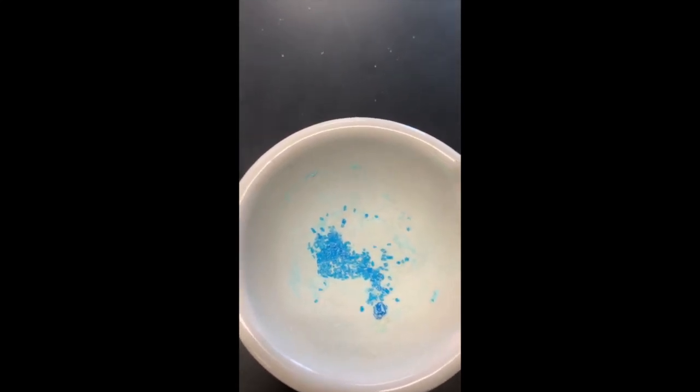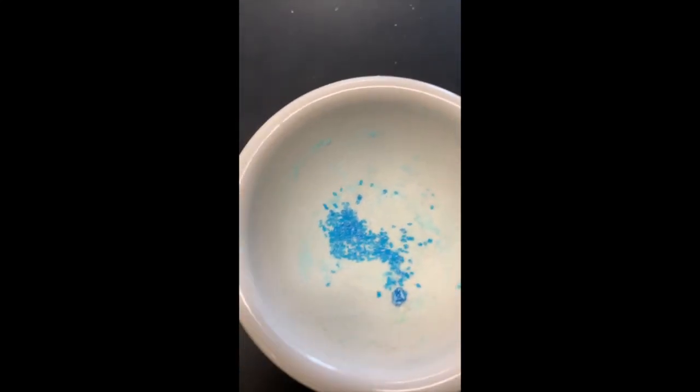Next, I'm going to take these crystals of copper sulfate and grind them up.